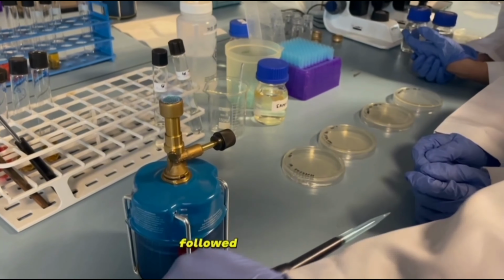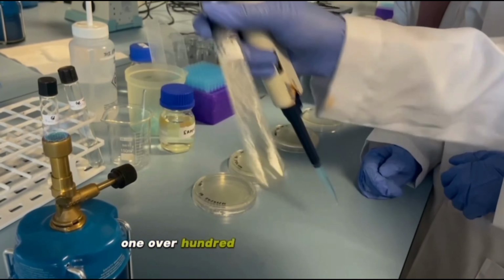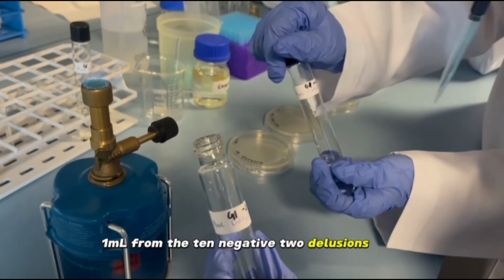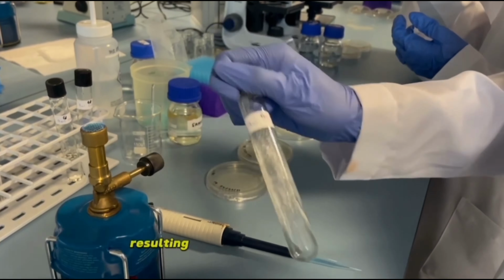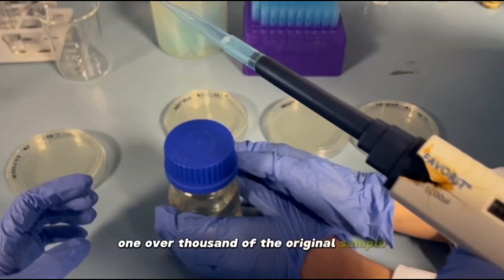Using a new pipette, 1 ml from the 10^-1 dilution tube was aseptically transferred to the 10^-2 dilution tube, followed by vortexing. This created a bacterial concentration 1/100 of the original sample. 1 ml from the 10^-2 dilution tube was transferred to the 10^-3 dilution tube and mixed, resulting in a bacterial concentration 1/1000 of the original sample.